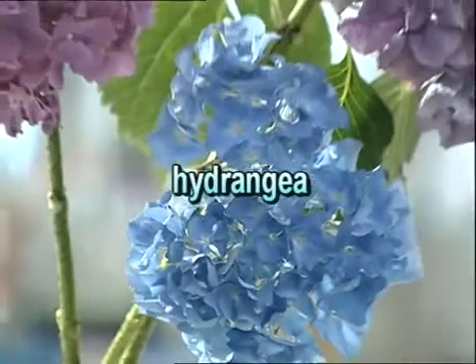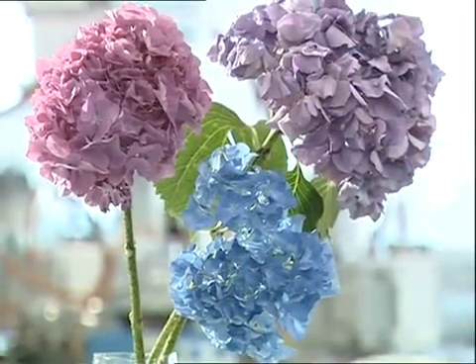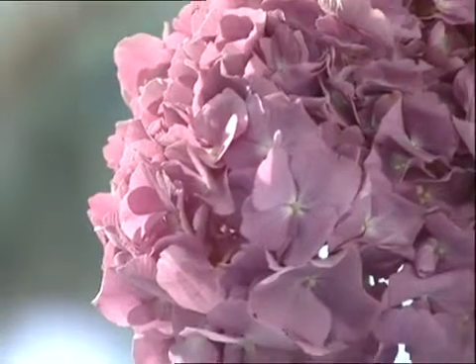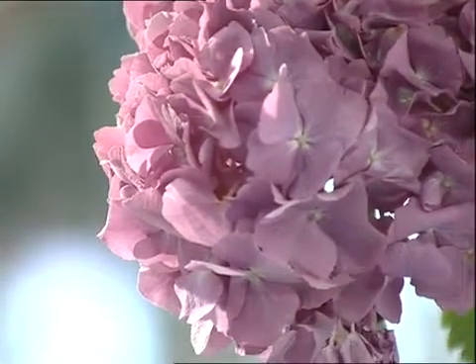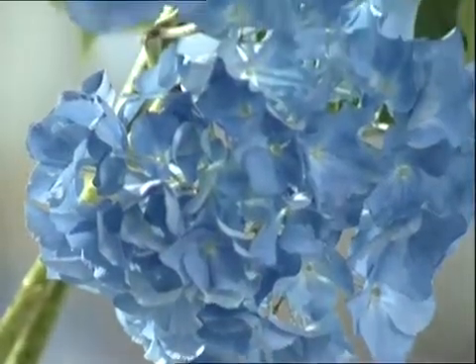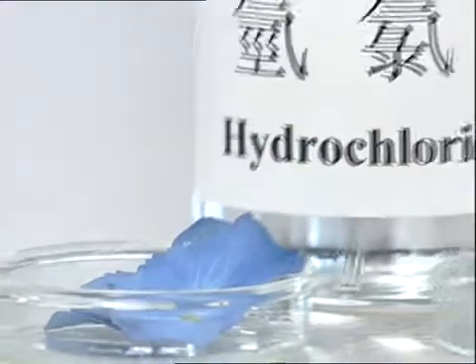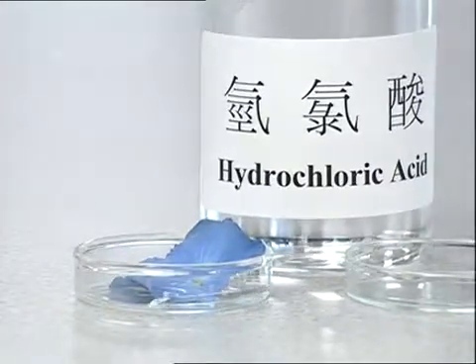The flower of the hydrangea plant can also be used as an indicator. If we plant hydrangea flowers in mud with different pH values, their color changes. If we place a petal of the flower into an acid, its color changes slowly.